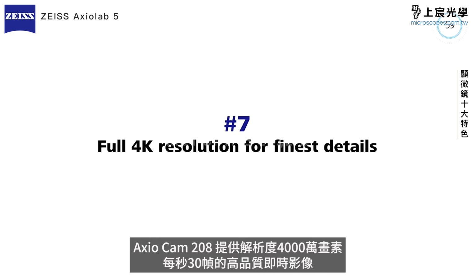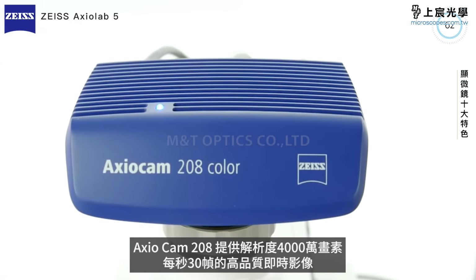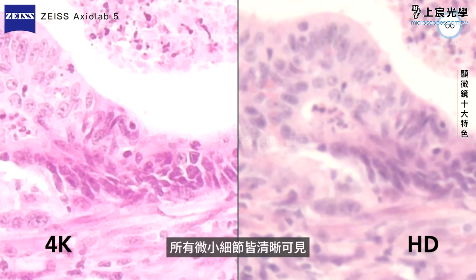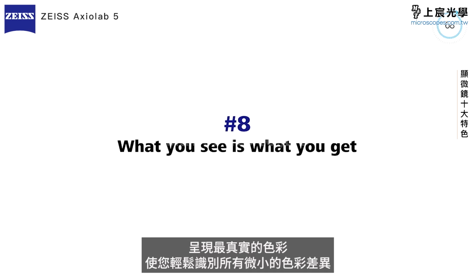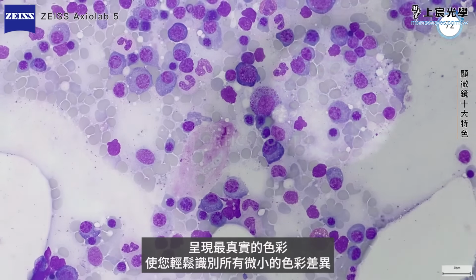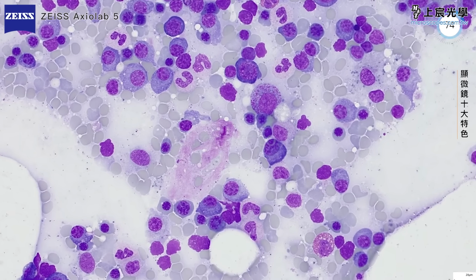AxioCam 208 provides live images with 4K resolution at 30 frames per second. Finer details are resolved and become discernible. Visualize and document your sample in natural colors where even subtle color differences are clearly visible.